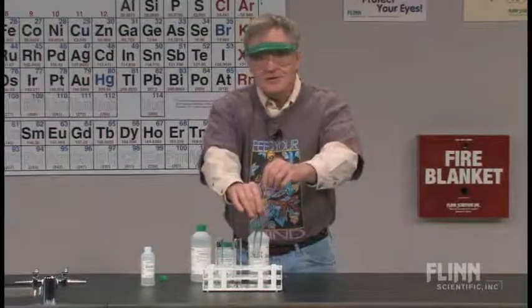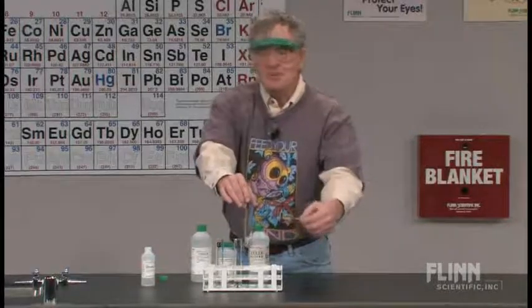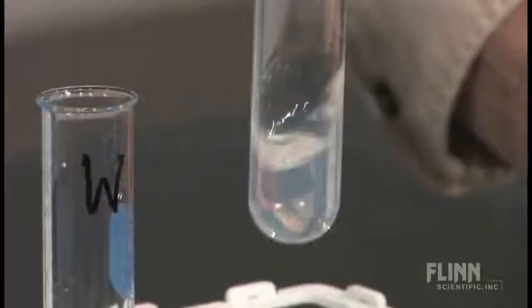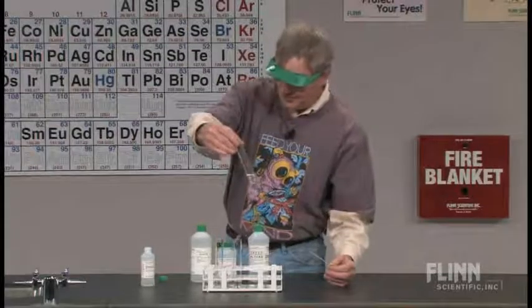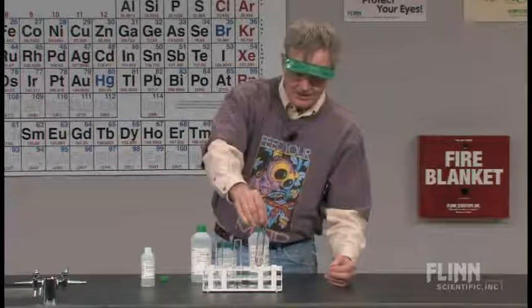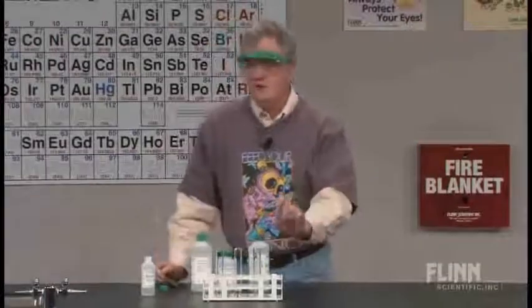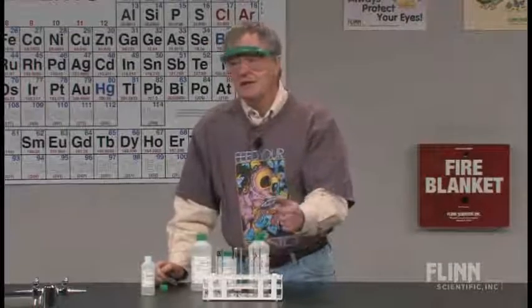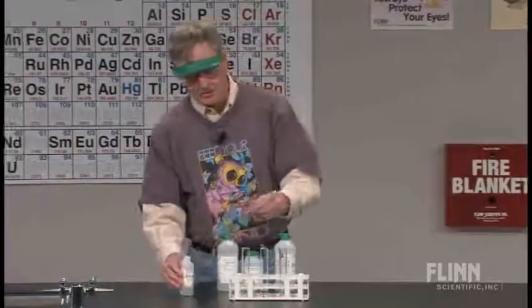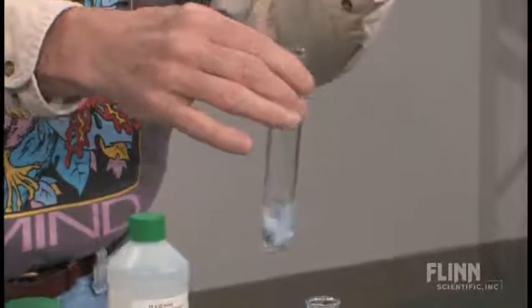Phenolphthalein itself is an alcohol solution. Phenolphthalein has a limited solubility in water, so when I drop it into the water and hydrochloric acid solution, the phenolphthalein precipitates out because the solubility changes a little bit, and I get that white cloudiness. This is actually a pretty good solution of phenolphthalein — sometimes when it's cheap and there's not much phenolphthalein, you won't get that cloudiness. The cloudiness is produced because phenolphthalein is much less soluble in water than it is in alcohol, and this is an alcohol solution.